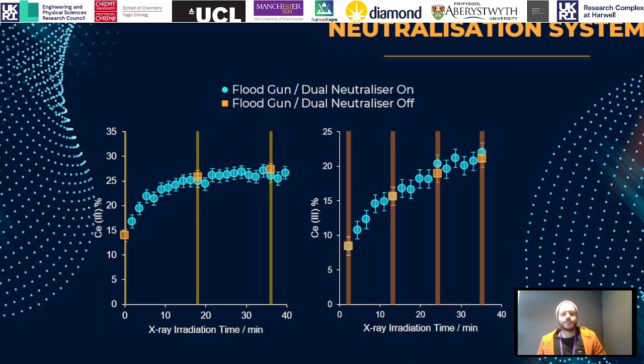One of the ways we would look to monitor this is to run a continuous XPS spectra with the flood gun on, and then take snapshots of our sample at set time points with the flood gun on, and then expose the sample to X-rays with the flood gun off. So we've got an example from our Kratos Supra on the left and the Thermo Nexsa on the right, for the cerium systems that we were looking at before, just commercial ceria.